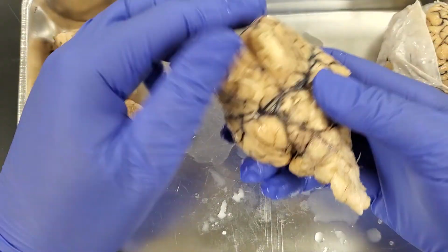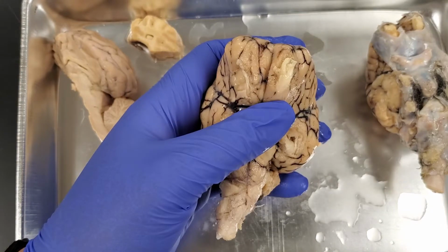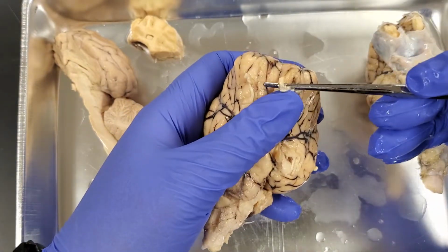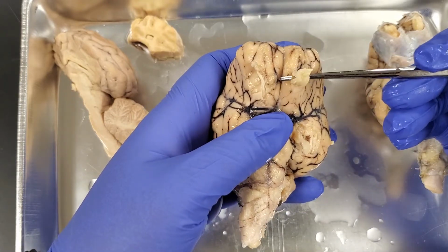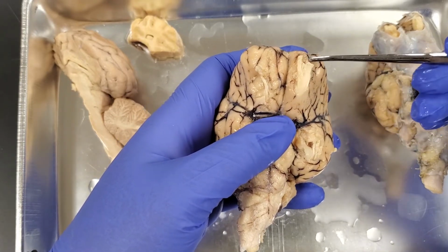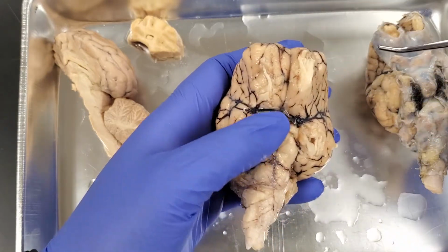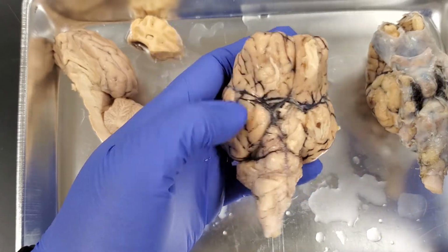Whenever I'm looking at this, there's a couple of things that I'm going to be looking for. You remember me talking about the olfactory bulb on the human brain. This is actually it on the sheep brain. So you notice it's a lot larger, and the reason it's a lot larger is sheep are going to use their sense of smell a lot more than we are because they have to find food, but they also have to avoid predators, okay?